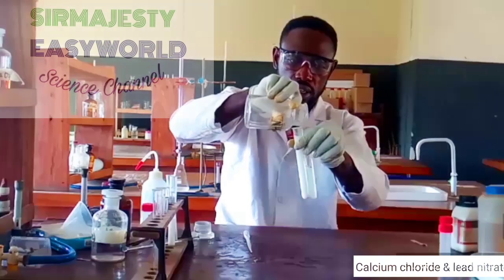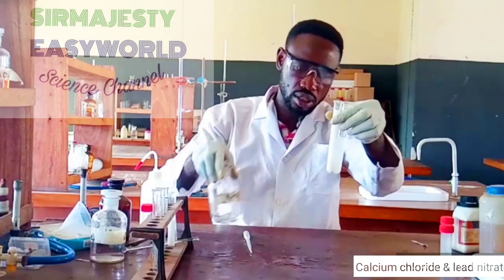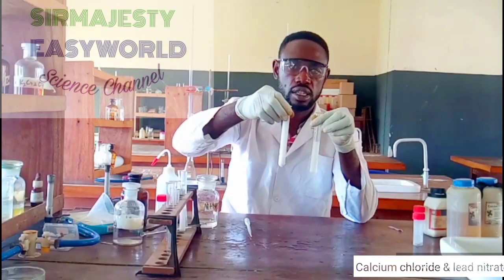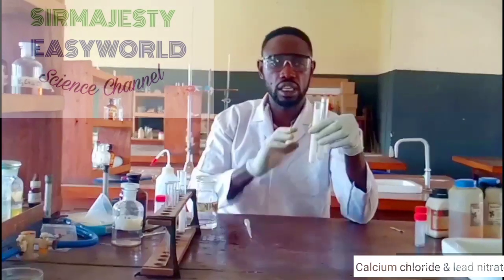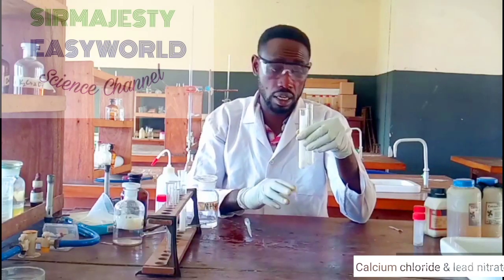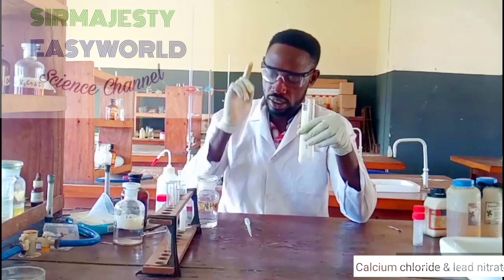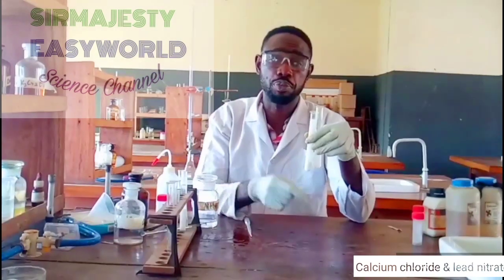It will still be turbid. So the turbidity remains. Both lead and calcium don't dissolve in excess aqueous ammonia. So when we are asked to add ammonia to either sample L or E, or sample A or B, meaning A is calcium chloride, B should be lead nitrate, depending on whatever you want to name it, just know that when you add aqueous ammonia to lead nitrate, there will be a white powdery precipitate in drops, which will persist in excess.